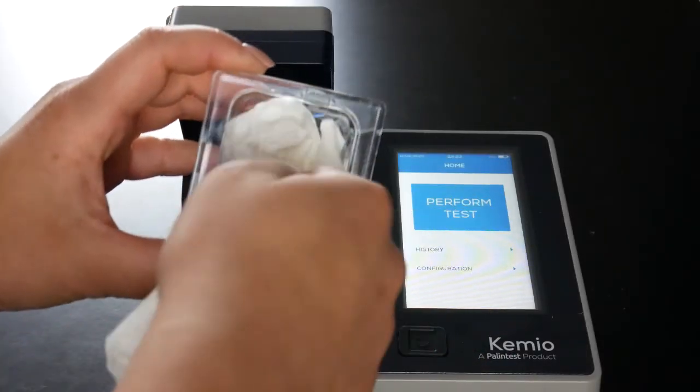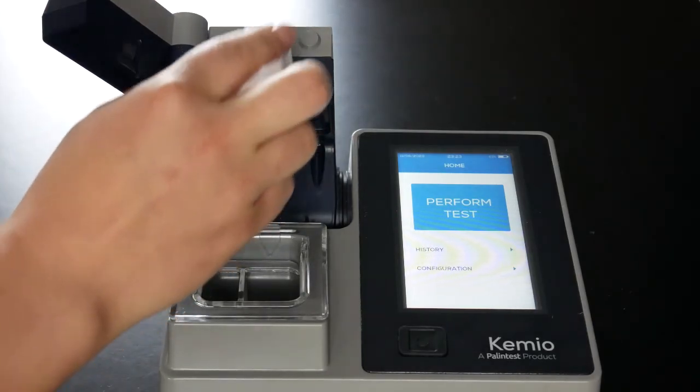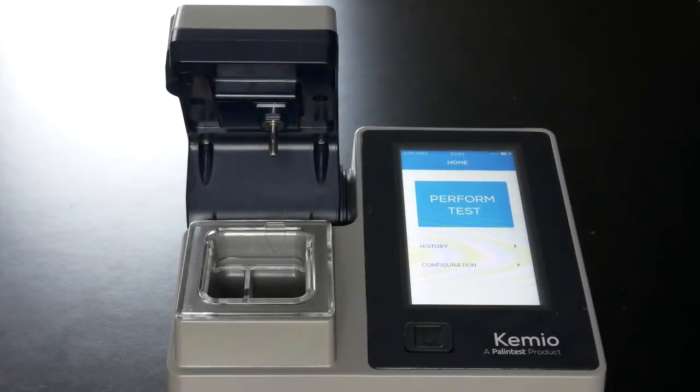Make sure to clean the sample vessel, probe, and contacts to keep your instrument in top shape for future use.